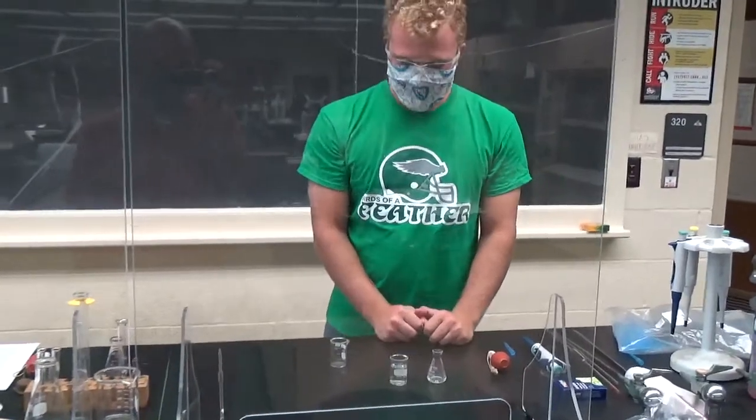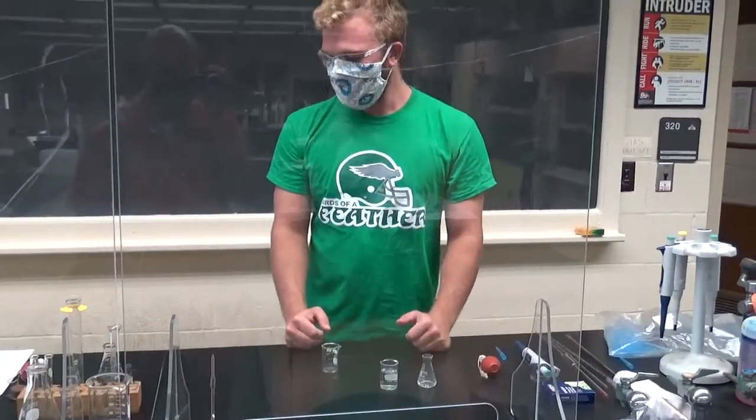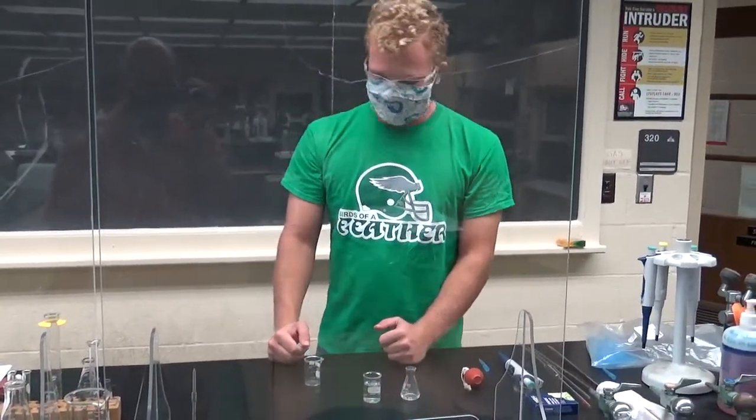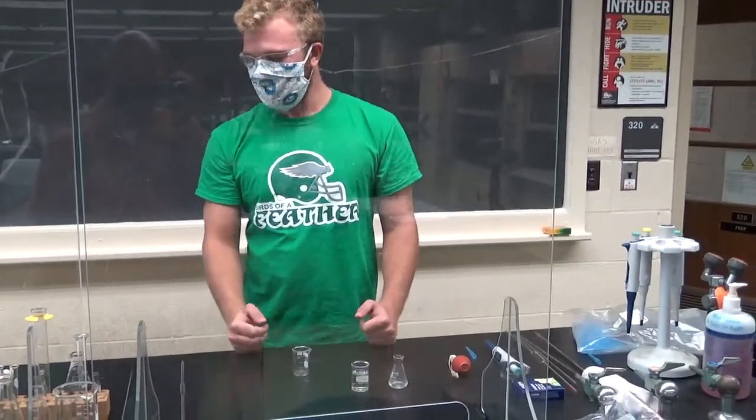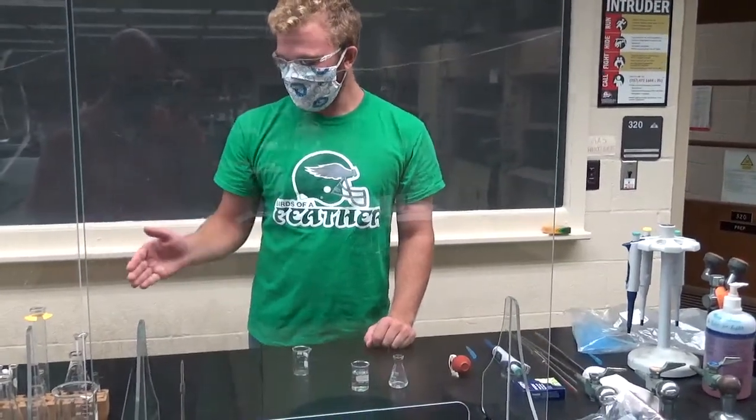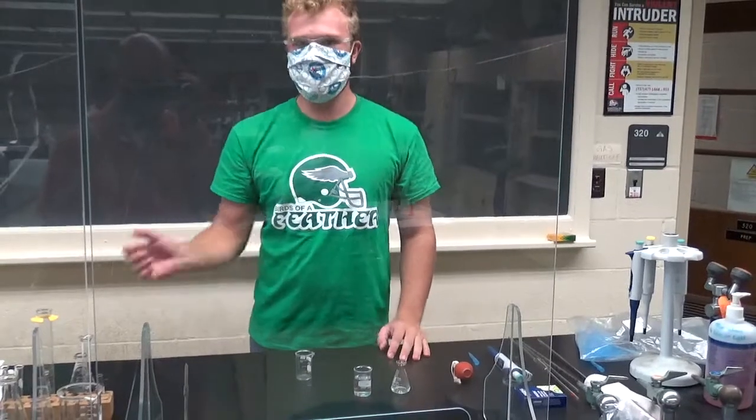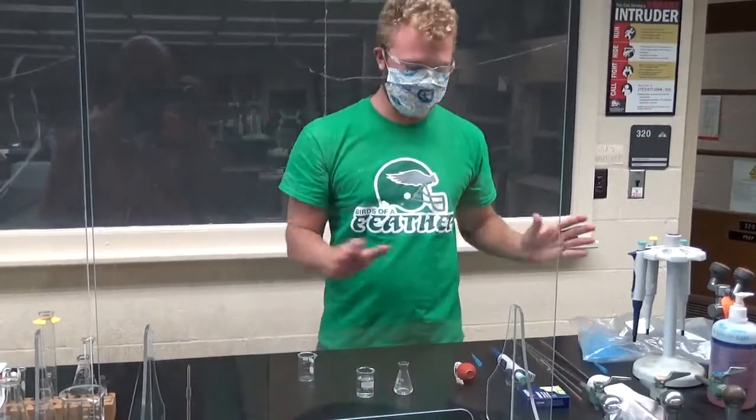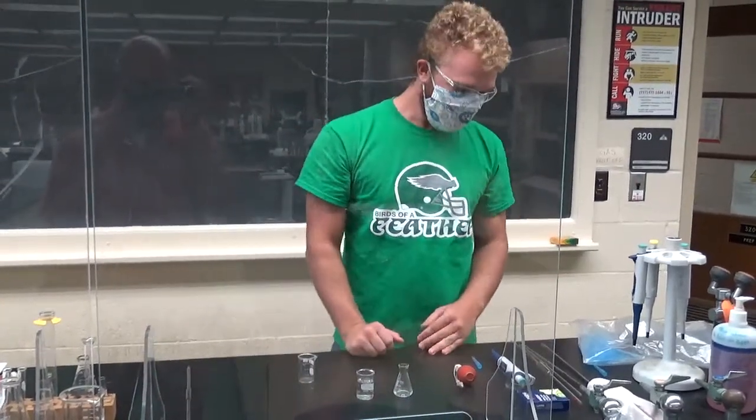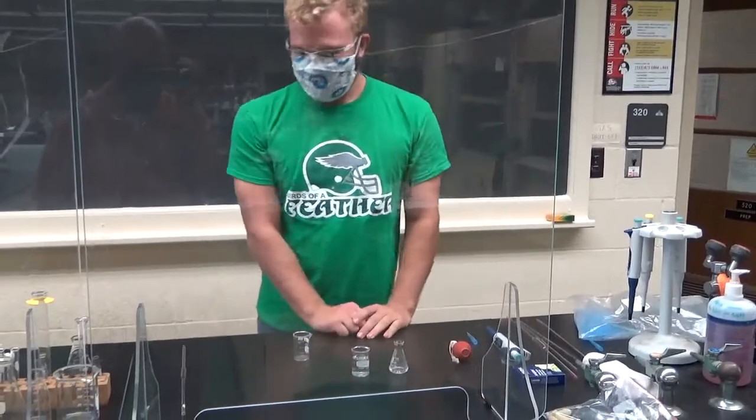So what containers should you pipette from? Really only you should pipette out of beakers. Everything else, beakers and, yeah, that's about it. You want to pour everything back into a beaker if you're going to move it to something else. That was a volumetric pipette.